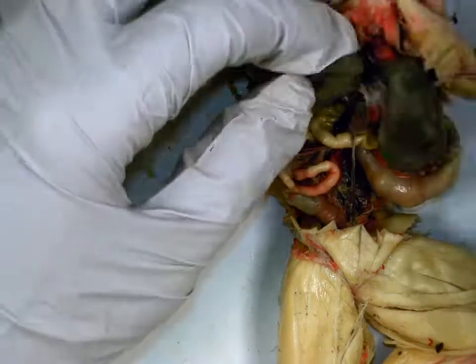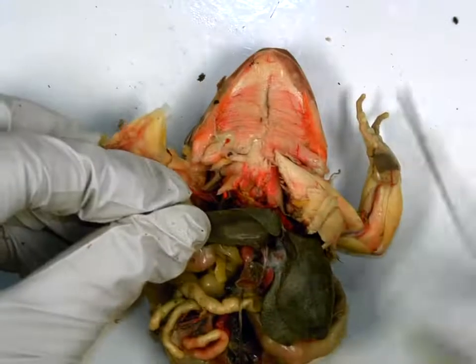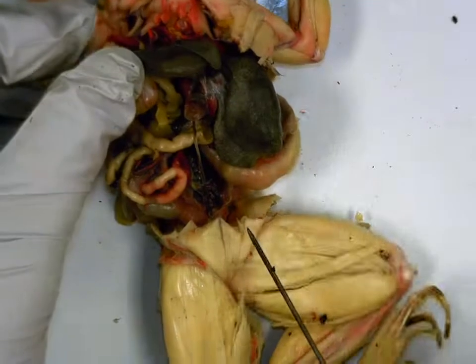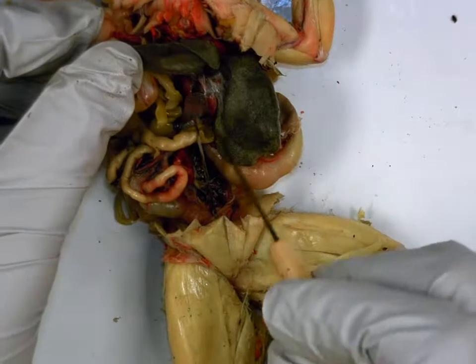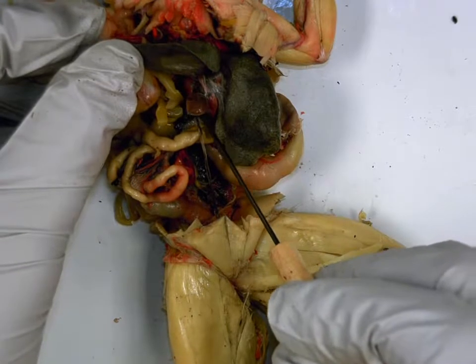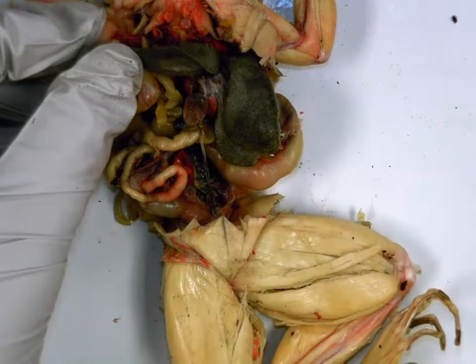Then we have this, and a student in second period said this perfectly. This area in between the 3 lobes of the liver looks like a dehydrated grape. Looks like a tiny little grape pouch, which is the gallbladder. What's the function of this gallbladder? Stores bile. So again, it looks like a dehydrated grape or a raisin in between the 3 lobes of your liver.